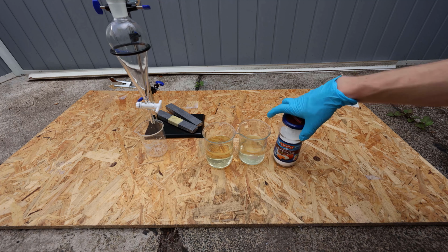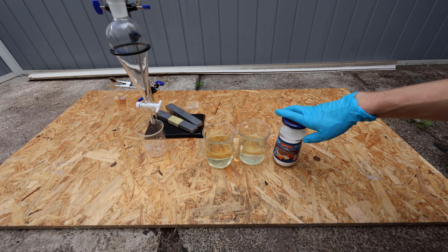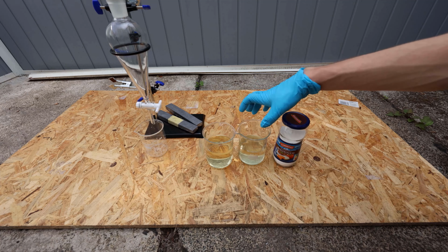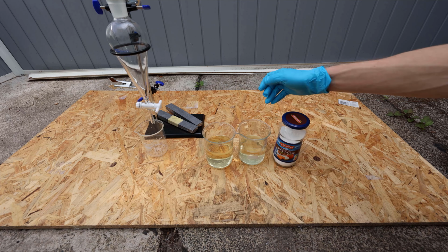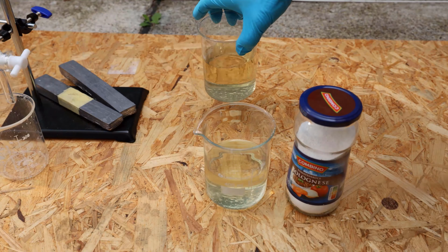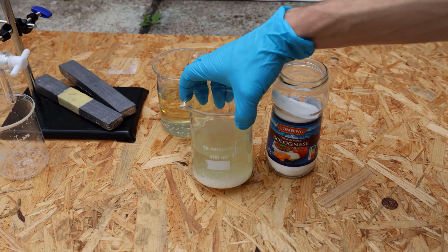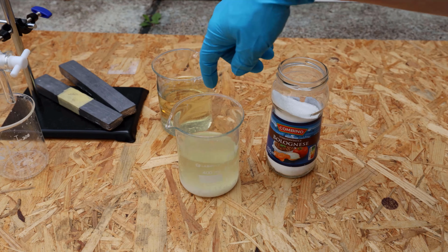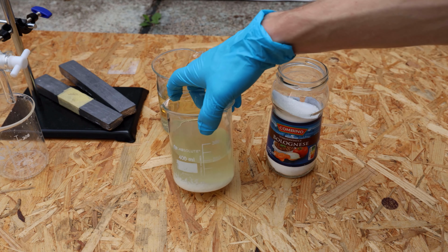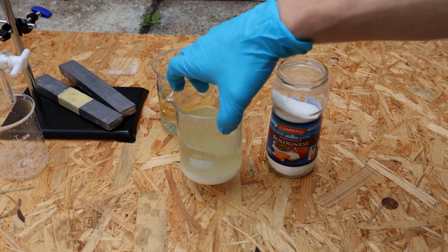I will put this in there, and I may have to use the separatory funnel because I think it also helps separate the water and the cyclopentanone, but I will see how this works. Let's for now use only this one. Alright, so far so good, I guess. This also reacts with any adipic acid that made it over into the receiving flask. Yeah. Let's add some more.